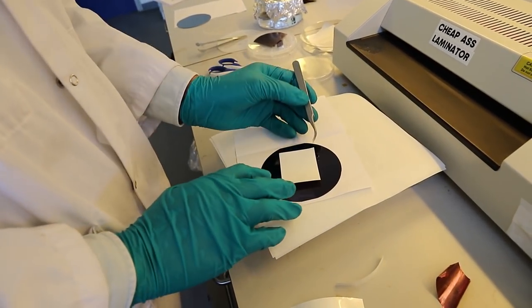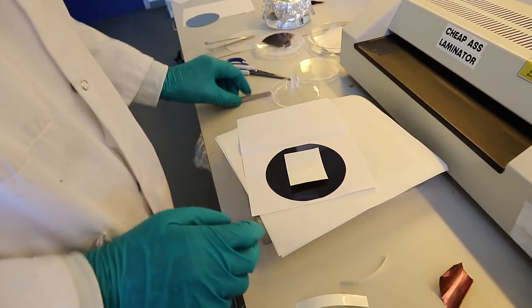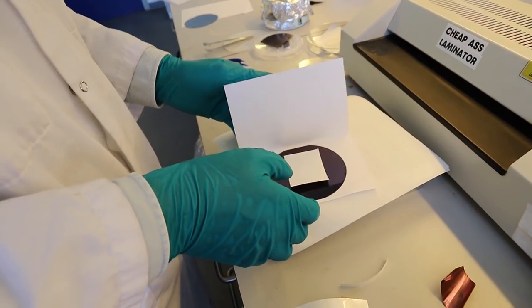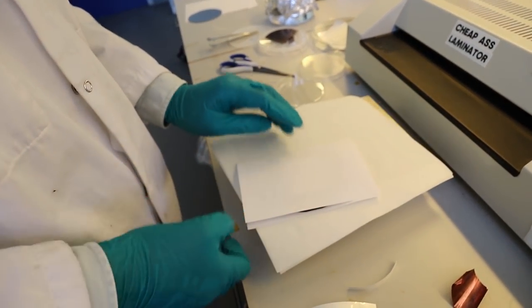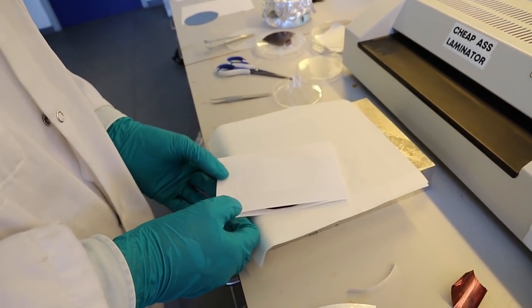So you're using the laminator once more? Yes. This lamination is going to now transfer the graphene from the polymer foil onto whatever substrate that you want using the same technique. What do you mean by whatever? What have you tried? Other substrates?